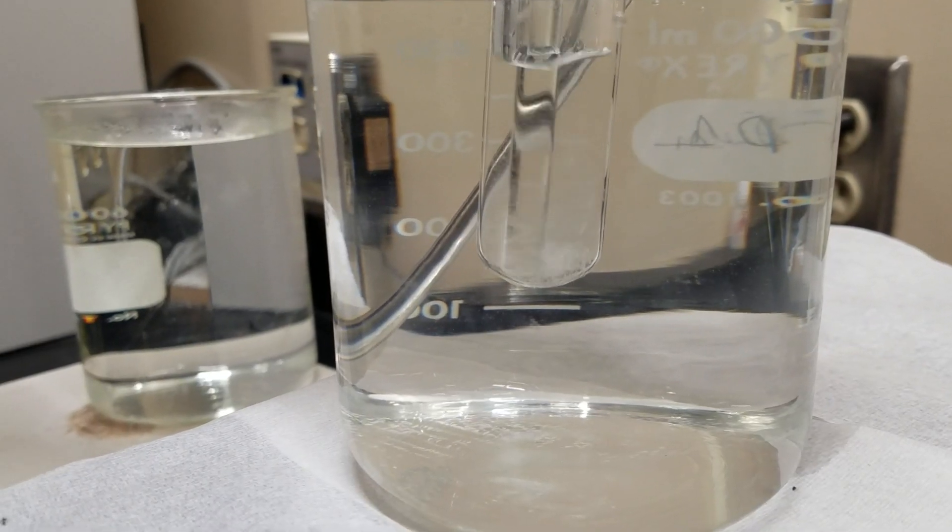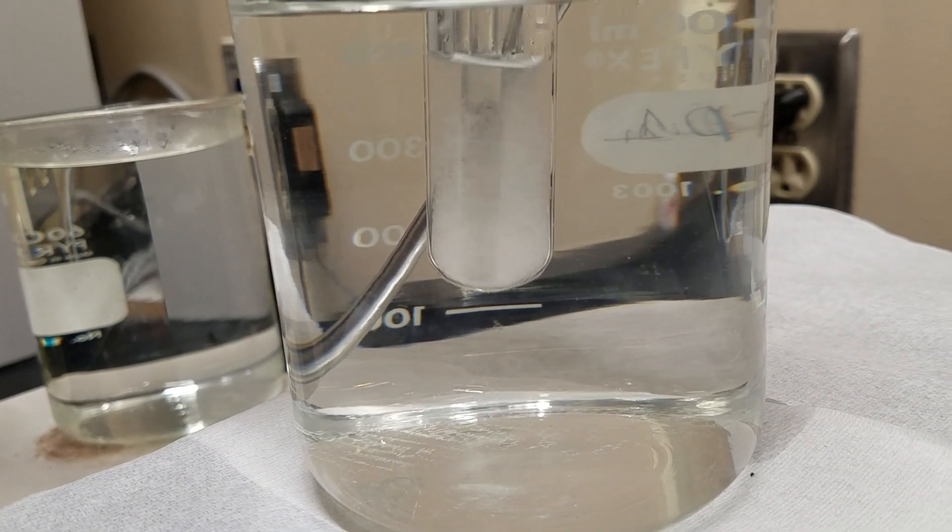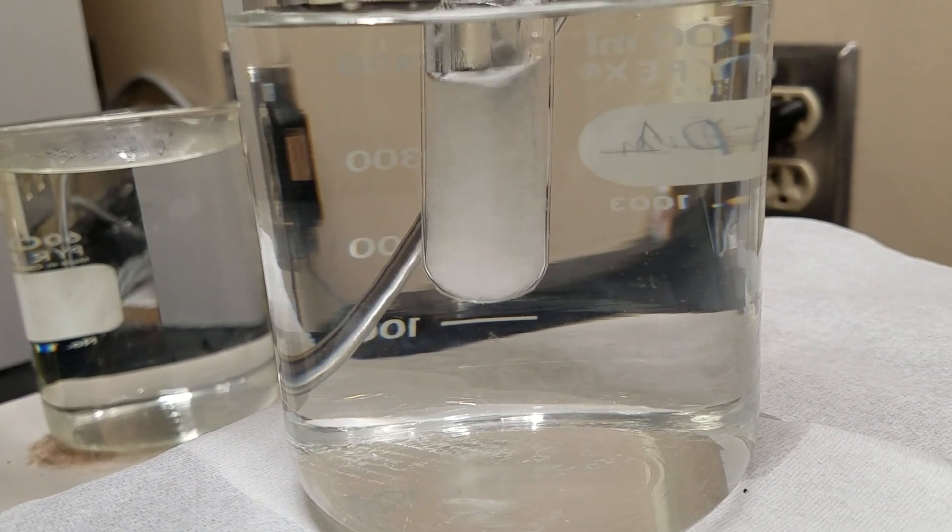Let's take one more look at that precipitation. Look how quickly it forms. In this experiment you'll need to pay close attention to catch that exact moment that you're looking for.